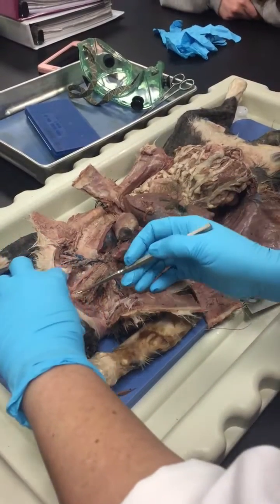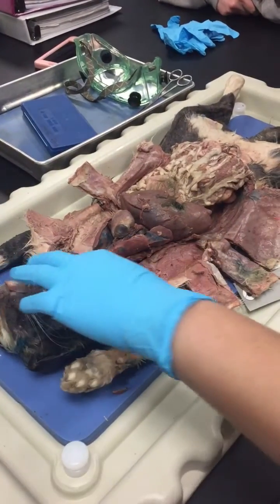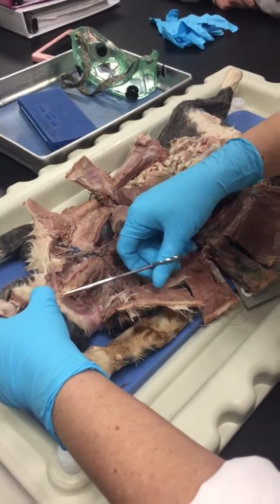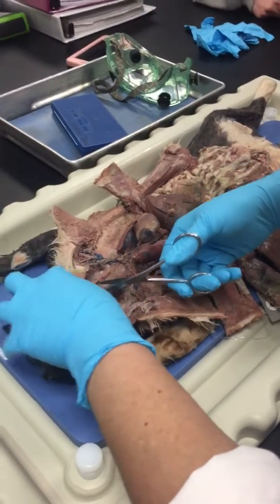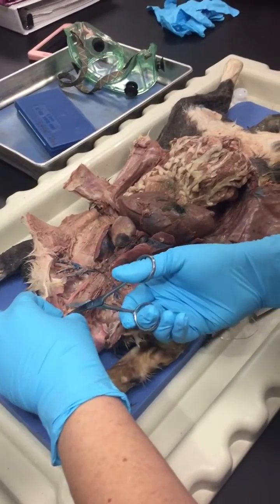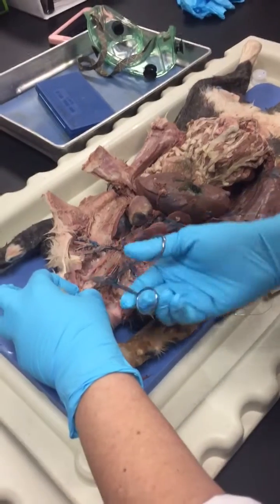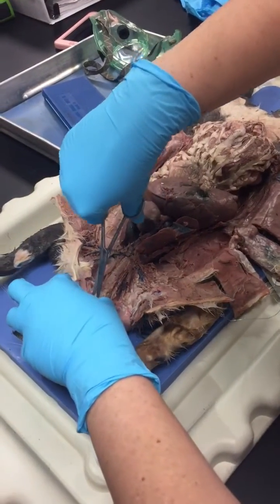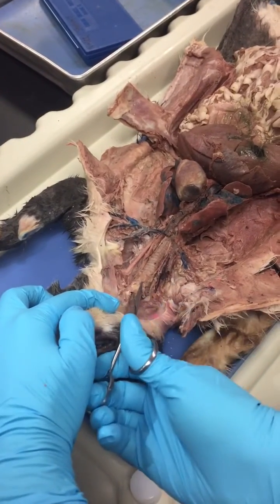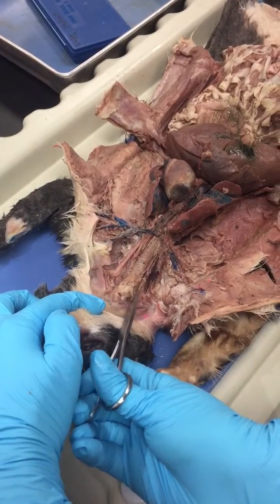I have tried actually to expose even the larynx of this cat. So here, right now, there, this structure. Do you want me to go into the larynx? Yeah. Alright, so if this is your larynx and if you cut into it, I'll take a piece off the larynx.